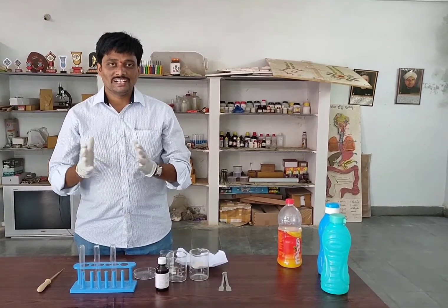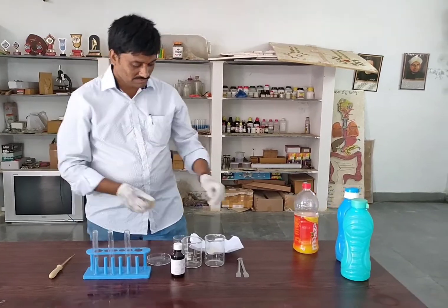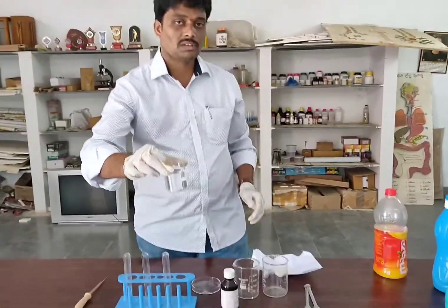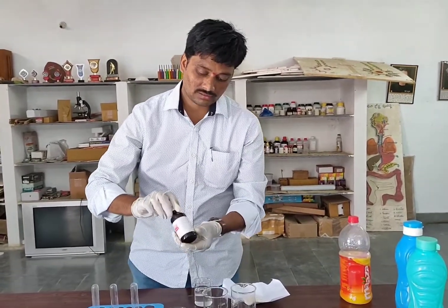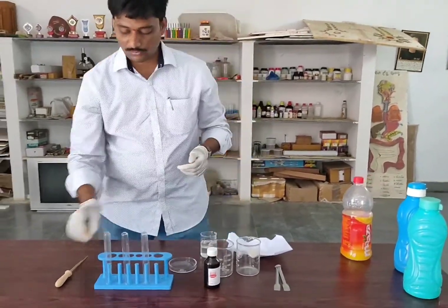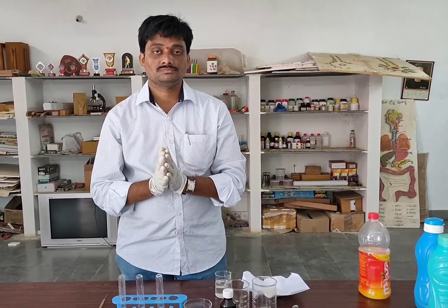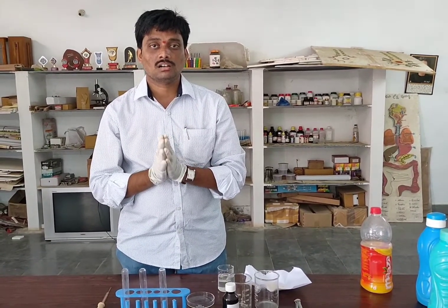To do this experiment, we need some materials. First of all, we have to take flour and a beaker of water, and for a tester, we have to take an iodine solution. These are the test tubes. And these are the materials required for the purpose of showing the action of saliva on flour.